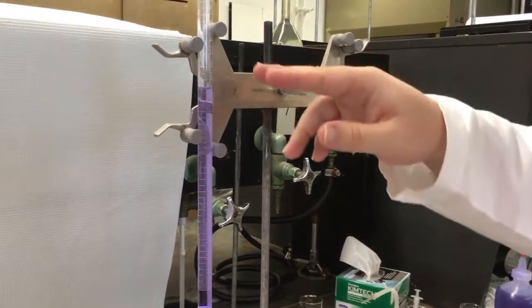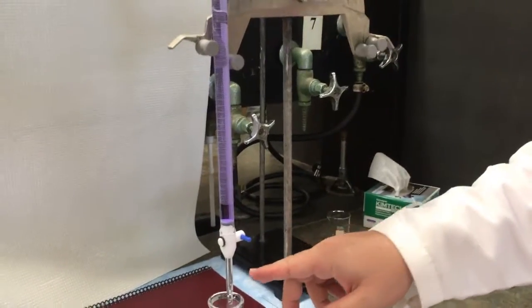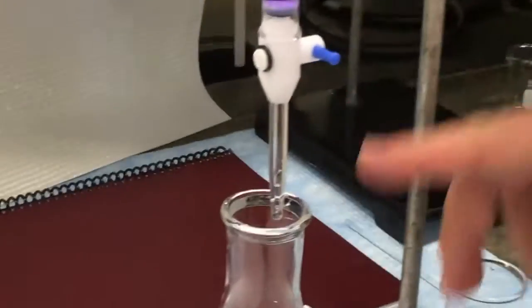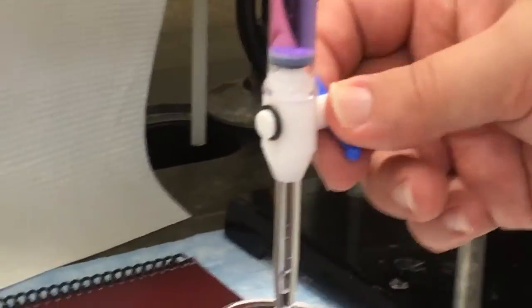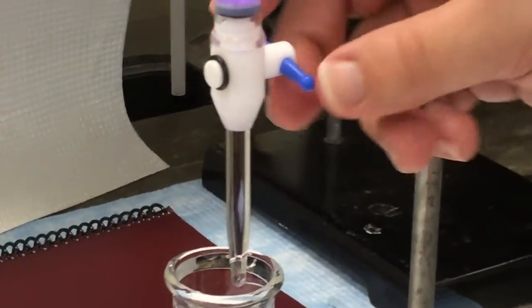Now the other thing you need to do when you load it, once you've got the solution in here, you need to load the tip. You'll notice that right now the tip there is empty. So I'm going to turn this, let the solution run through, and then stop.